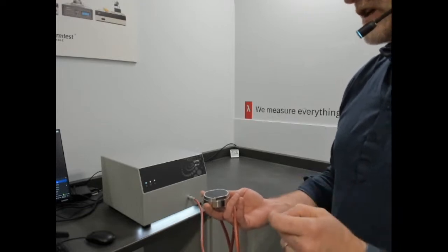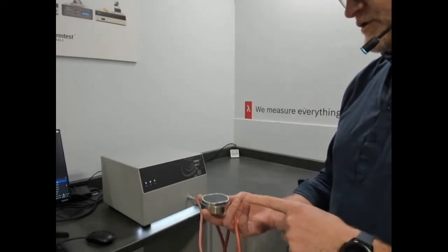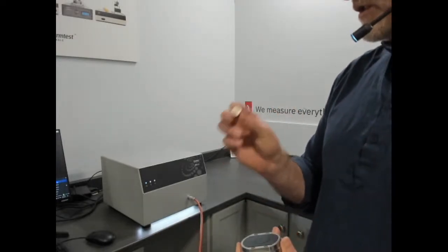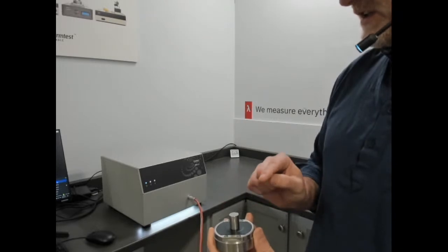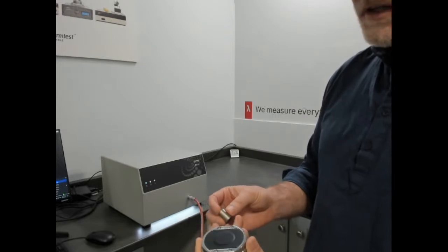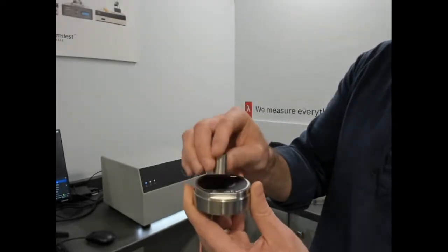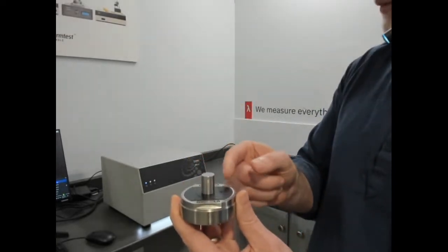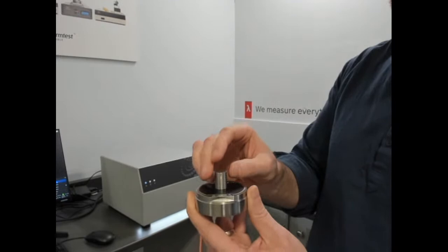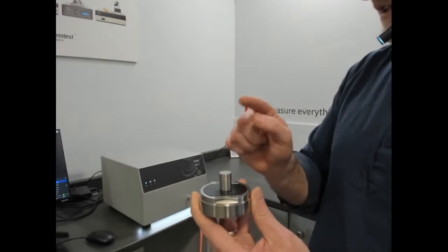It describes two configurations of a sample and sensor for measurement of effusivity, and we're going to talk about those. One is a one-dimensional shape, when the diameter of your sample is equal to that of the diameter of your sensor. In this case, we have a 12.8 millimeter diameter sensor. If your sample is equal to that or just slightly larger, the heat propagation is along the direction in the elongated material. We can measure the transient plane source, and the ISO describes measurement of direct effusivity.